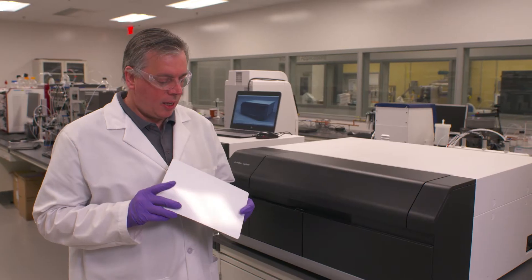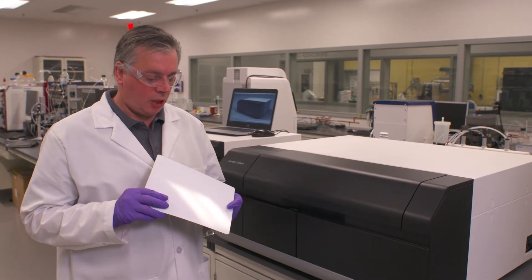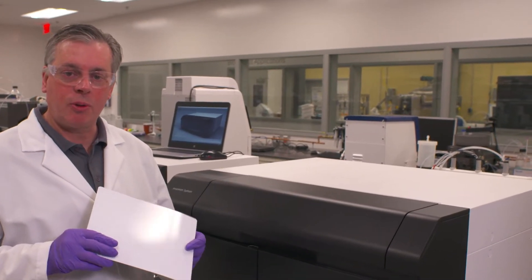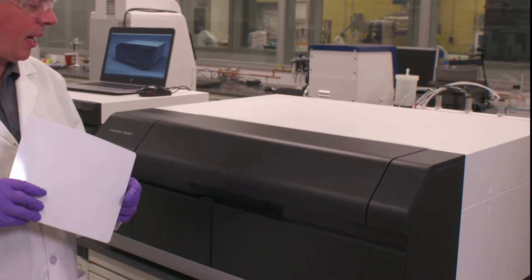In this session, we're going to look at using a screen that is not able to fit onto the magnetized stage. So it would not have the ferrous material in the back of the screen.